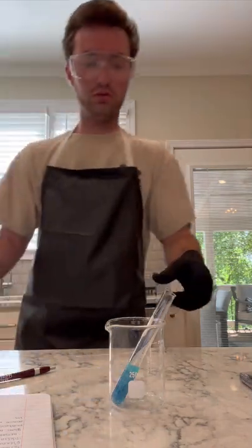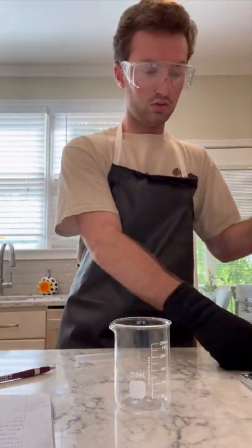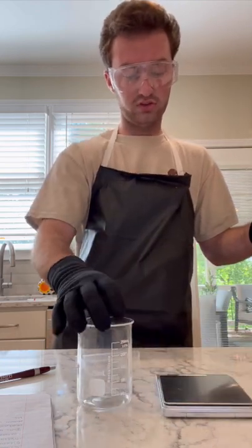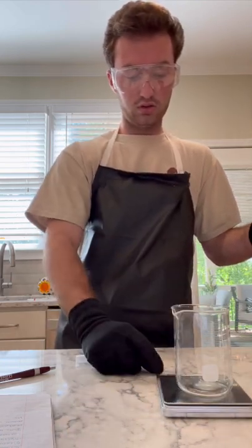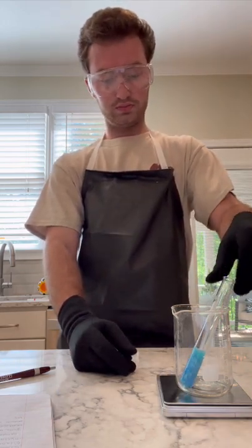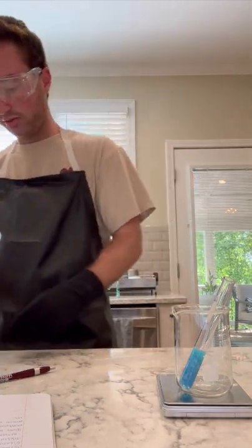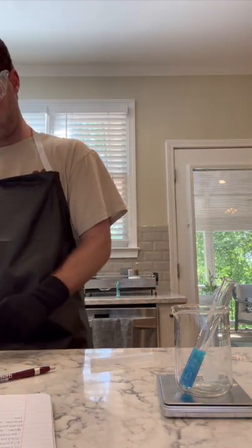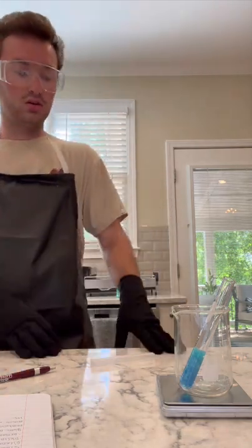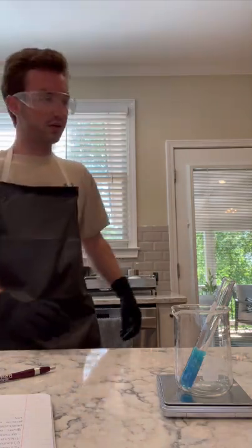Now I'm going to do the same thing, like I said. I'm going to take the mass of that. I'm going to place my beaker on first and tare that. We got a mass of the product of 26.05. So if I do 26.05 minus 19, we have a mass of 7.05, which, if you take the masses added together, is not really much of a surprise.